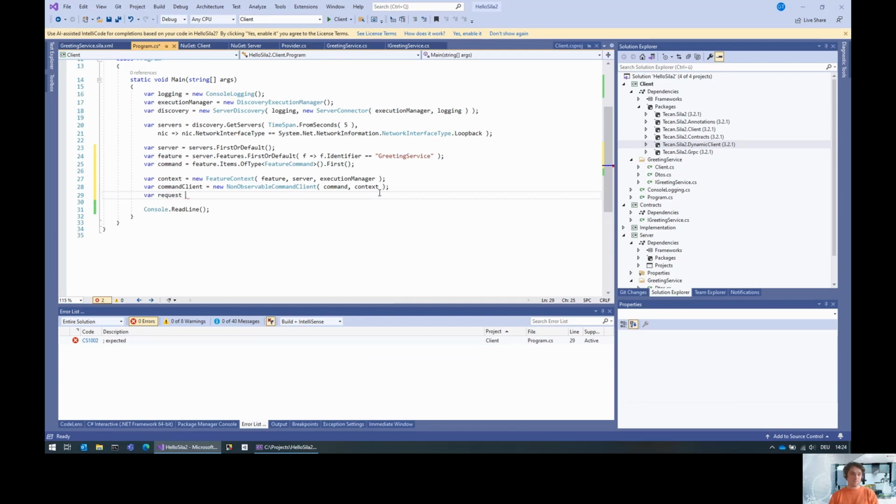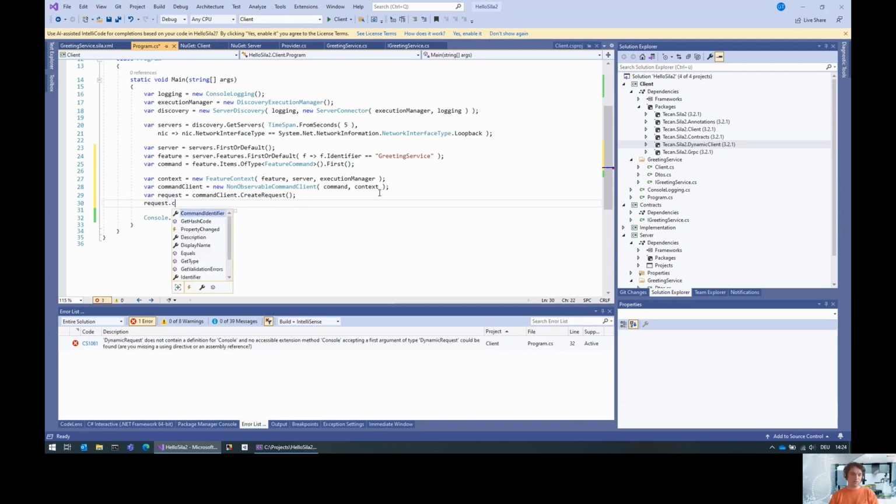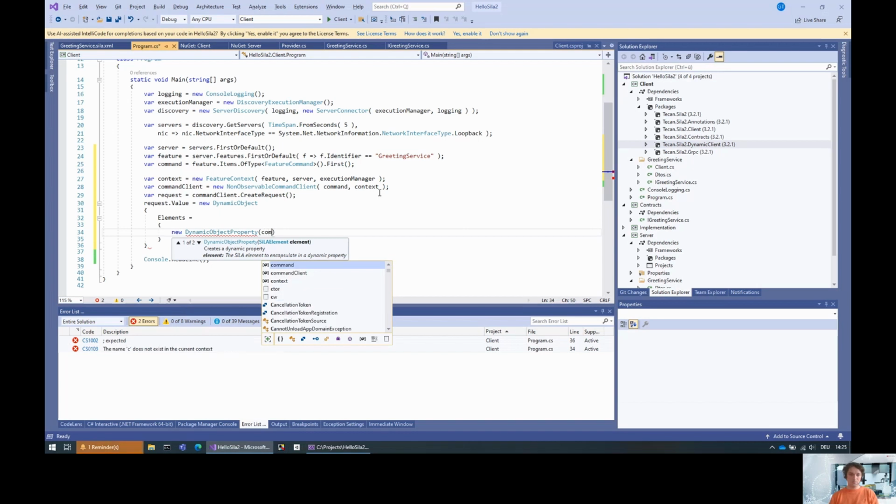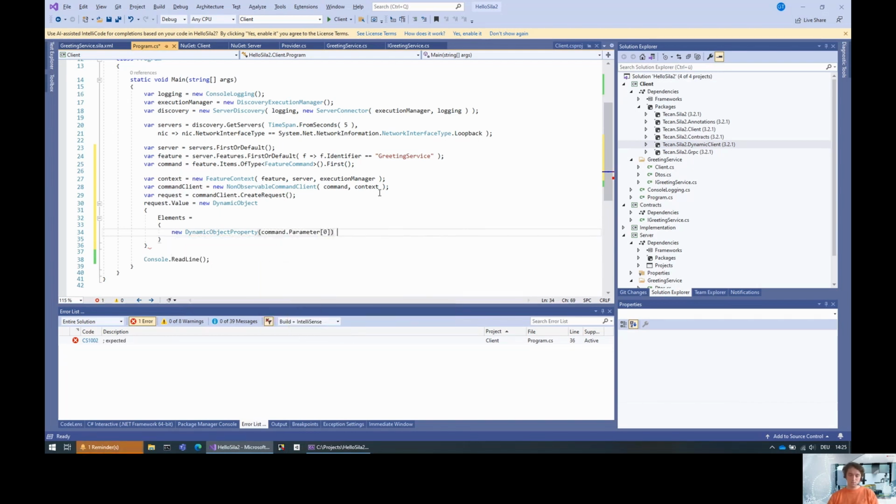Then we create a request, and that is just command client dot create request, and then we fill this request. So request dot value is, and here you may think that we just put in the name that we're interested in, but the command might have multiple parameters, and therefore we need to pack this into a dynamic object, and put in an element, which is a dynamic object property for the command's parameter. And the value of this is dynamic client. Okay, so we just created a request.